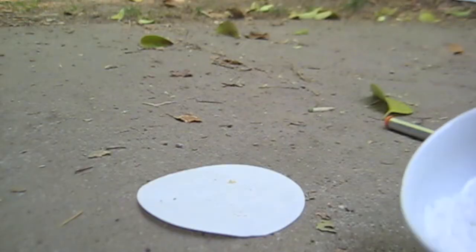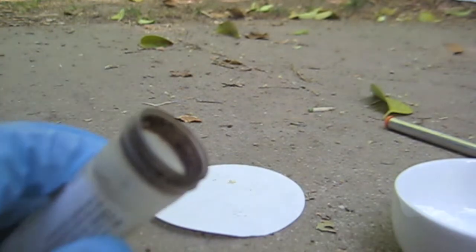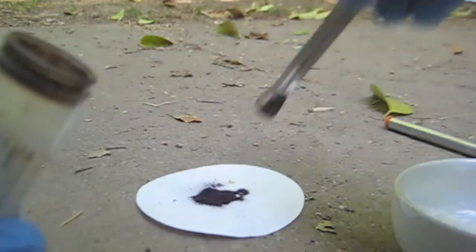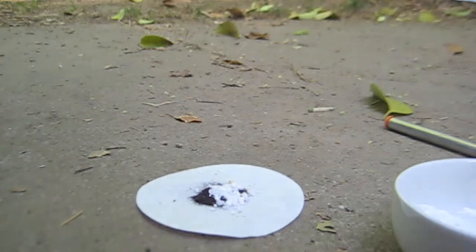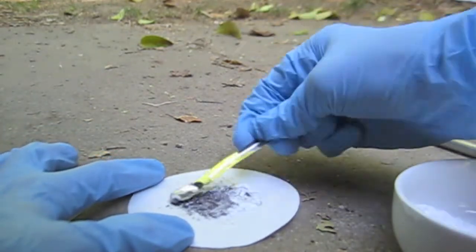So now I'm gonna do it again, except I'm gonna use powdered sugar instead of regular sugar to get a faster reaction, and then just use a tiny bit of water. One scoop of potassium permanganate and one of powdered sugar. We'll mix the two together really well so they'll be able to react quickly. Okay, so I'm gonna add a drop of water.